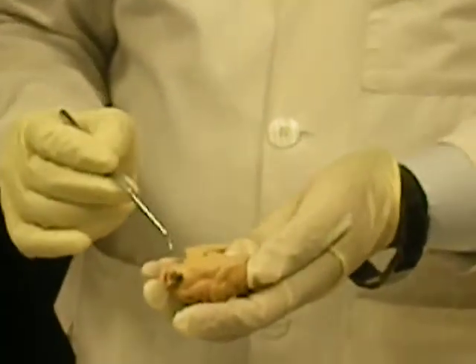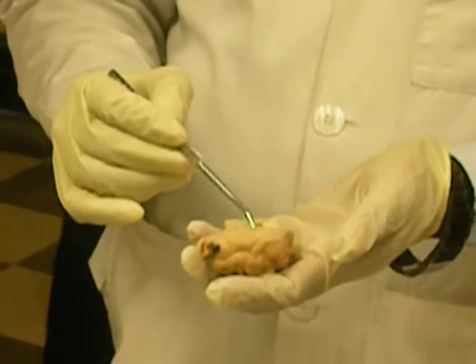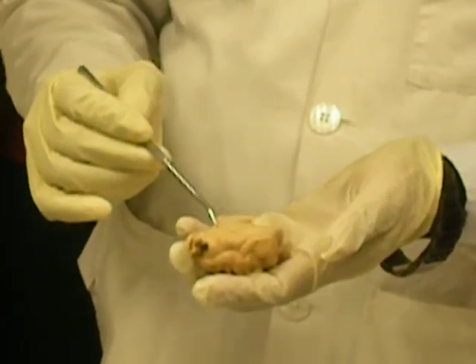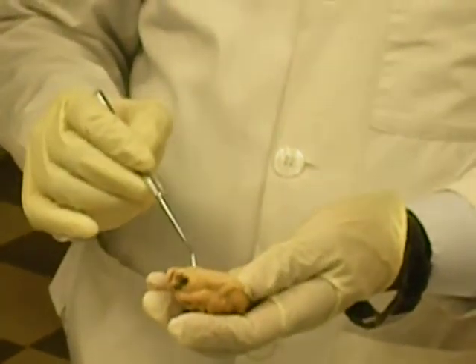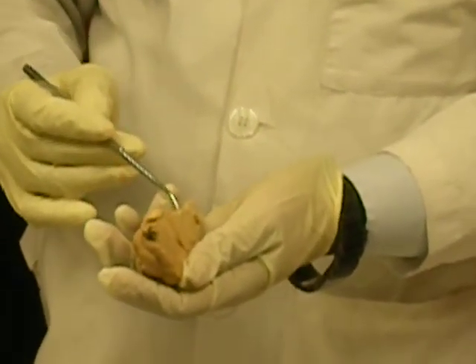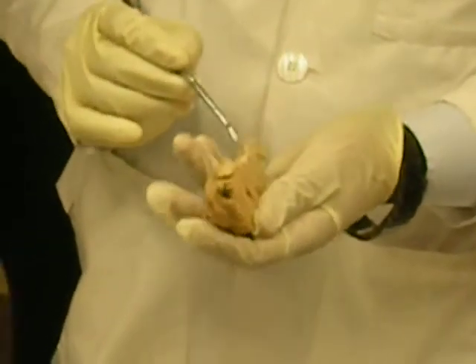And what are the regions of the brain? You know that this is called the cerebrum as a whole, this is the cerebellum, and this part basically is the diencephalon. It's also from the forebrain, but this part is the diencephalon, while we have got the thalamus right here, hypothalamus right below that, and we should have the pituitary gland right here. They have got the pituitary gland, you don't, but the pituitary gland should be right here. And we have got the pineal gland somewhere here, but I'm not going to ask you any question about that.